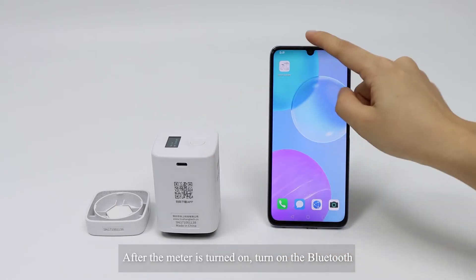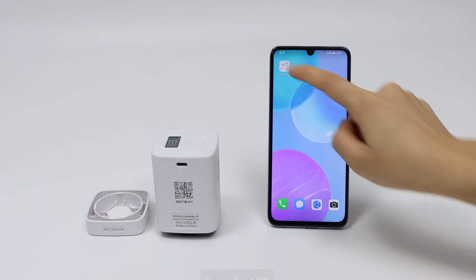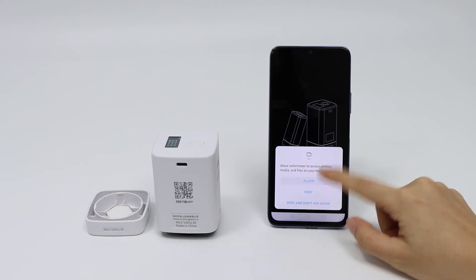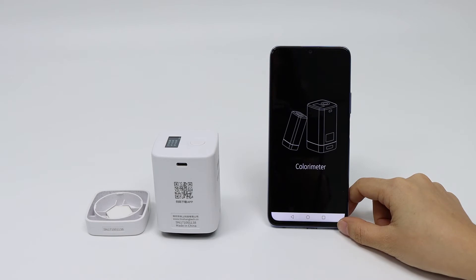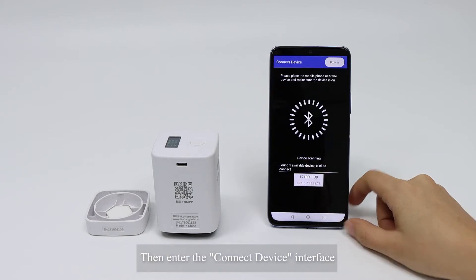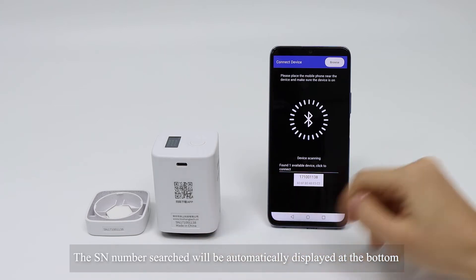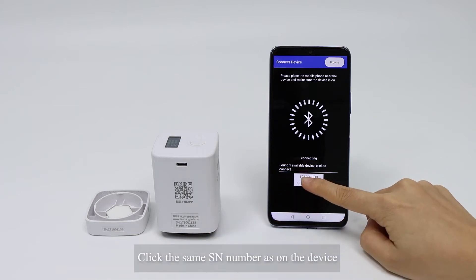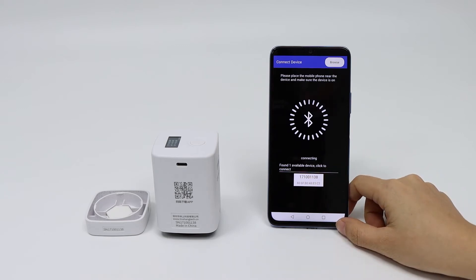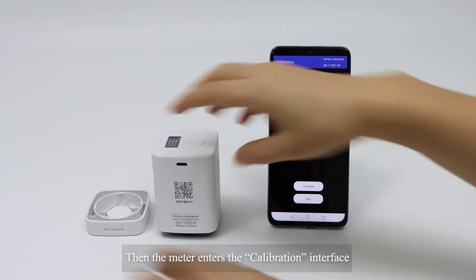After the meter is turned on, turn on the Bluetooth and open the app. Select permission to allow all the time, then enter the connect device interface. The SN number will be automatically displayed at the bottom. Click the same SN number as shown on the device.